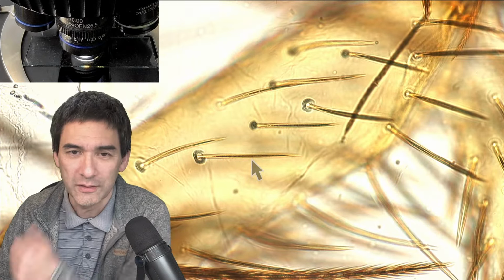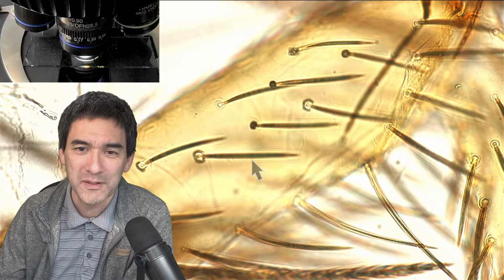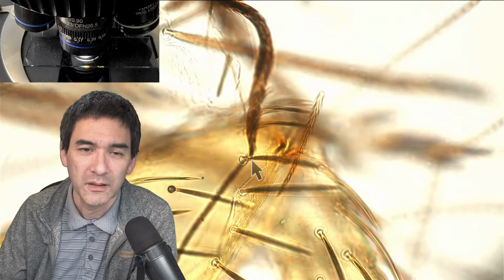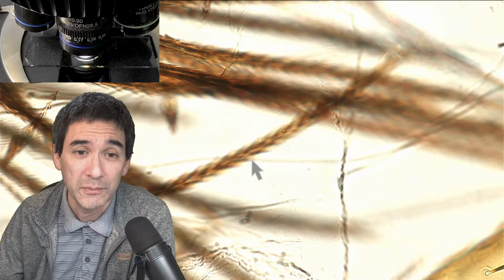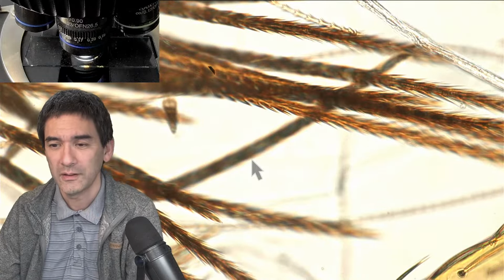There is usually some rule of thumb, as we say. We have to wait about 6 weeks until the medium is completely dry, depending on the amount of mounting medium that you're using.